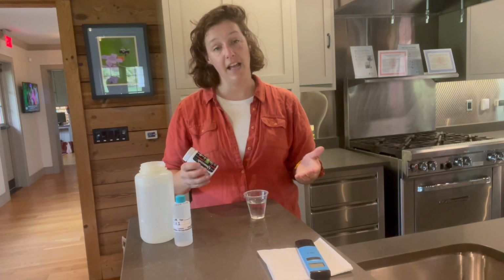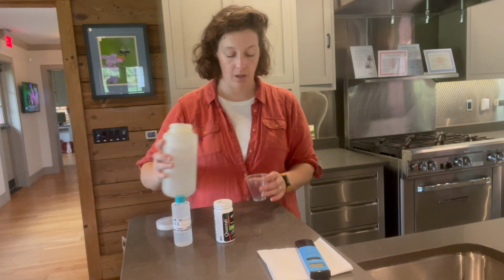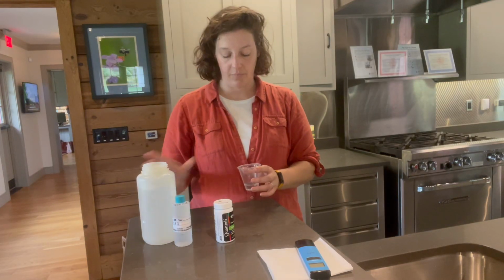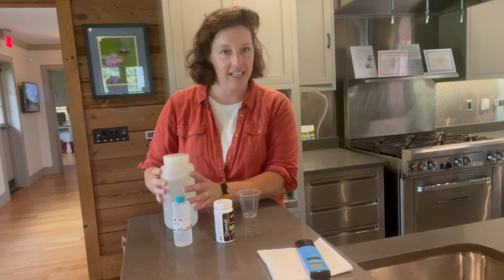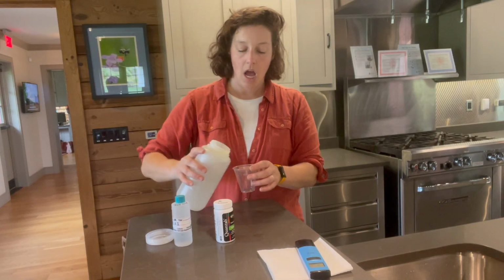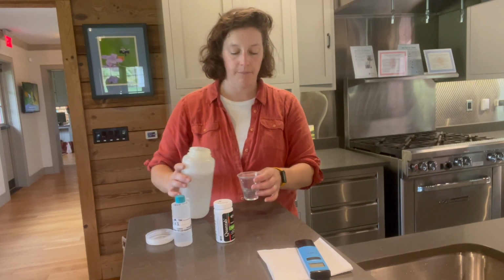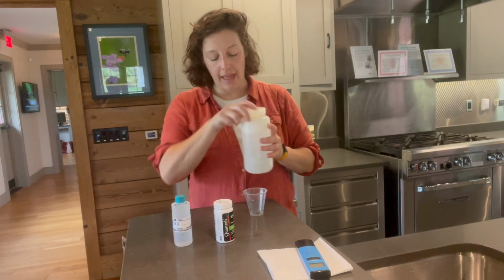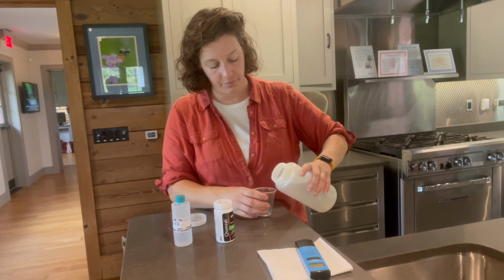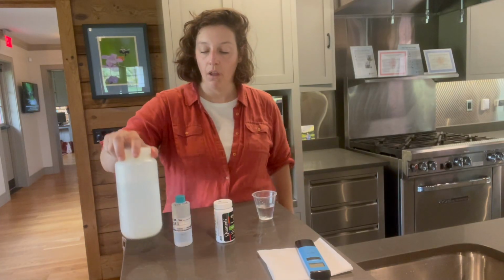And if it is, you should call your Penn State Extension office to let them know and find out what you can do to help your stream. So for our chloride measurement, we'll be pretty prudent and we'll give a nice triple rinse. Our sample's been sitting for a minute, so I like to give it a shake to make sure nothing's settled out. Give it another triple rinse, so anything that was on our conductivity meter is not transferred to our sample and giving us an abnormally high reading. And then we will fill our sample with about 1.5 inches of water.